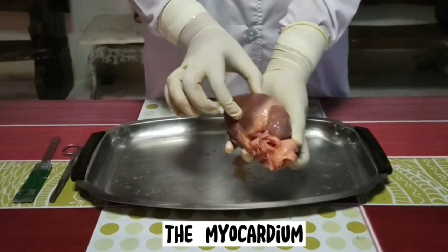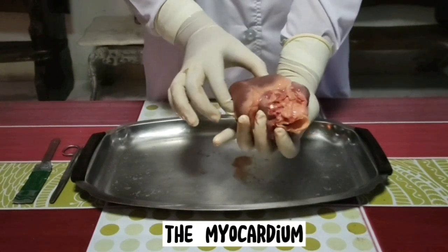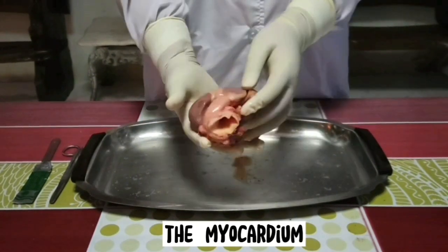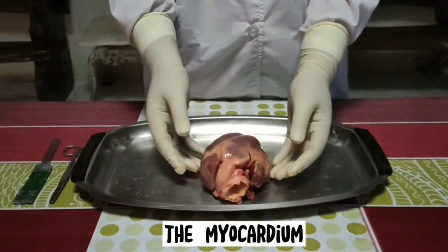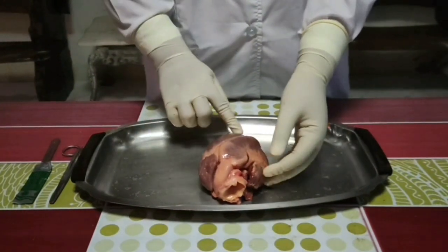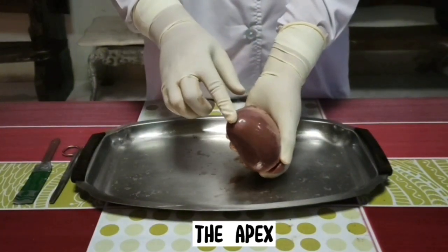This is the myocardium. It is the muscle of your heart called the myocardium. Most of the myocardium is located in the lower of two chambers of the heart called ventricles. This is the apex of the heart, and this is the base of the heart.